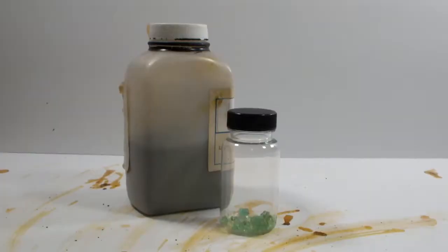I got bored with this whole thing about halfway through the bottle. Remarkably though, I recovered just under 3 grams. I was expecting far less, but I could see the loss of far more. I didn't bother measuring the starting weight, but if we assume half is 250 grams, this was a whopping 1% recovery. But what happened to the other 99%?